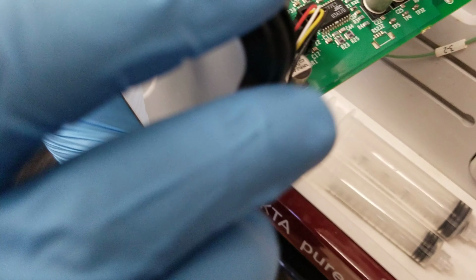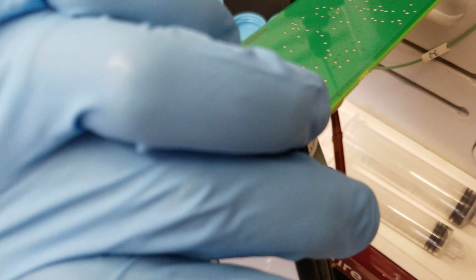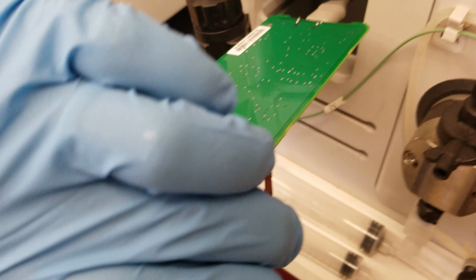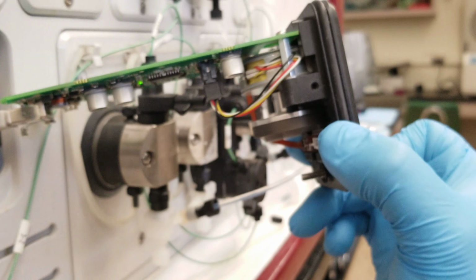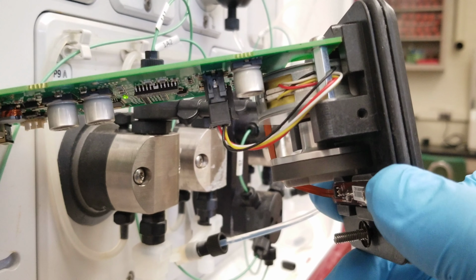Oh wait. Oh, this is the screw. Well, hold on. Not the screw. It's not the screw. It's hitting something. What is the sound? Can you just take your camera right there and get that sound? It's just hitting against something.